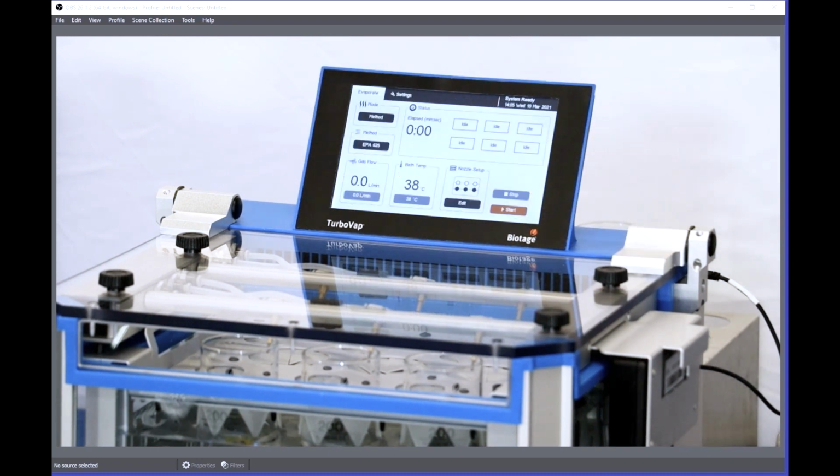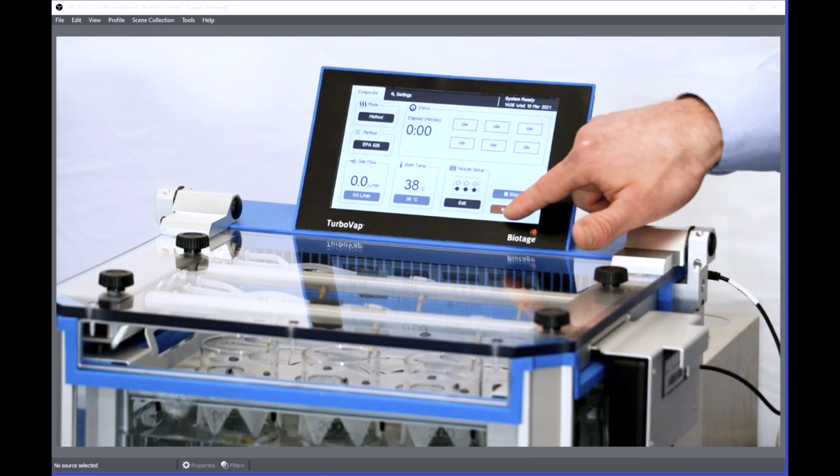So now that I have my protocol for concentration and my tube selected and my nozzle selected, I will go ahead and start.